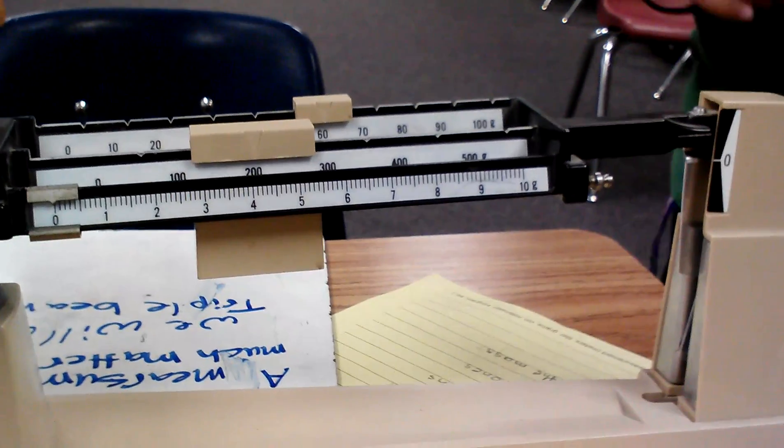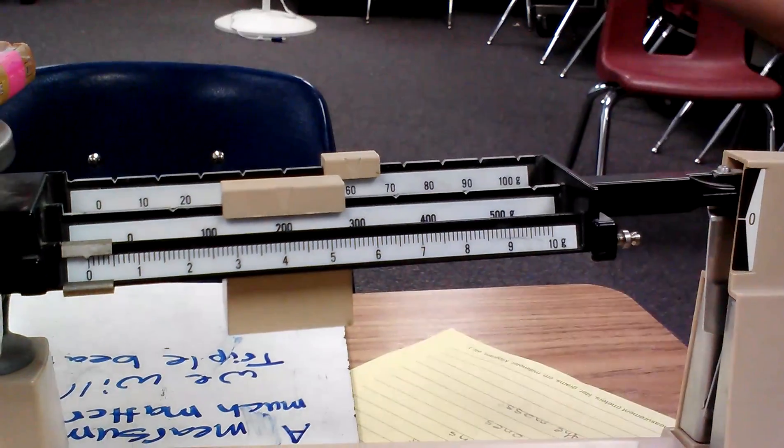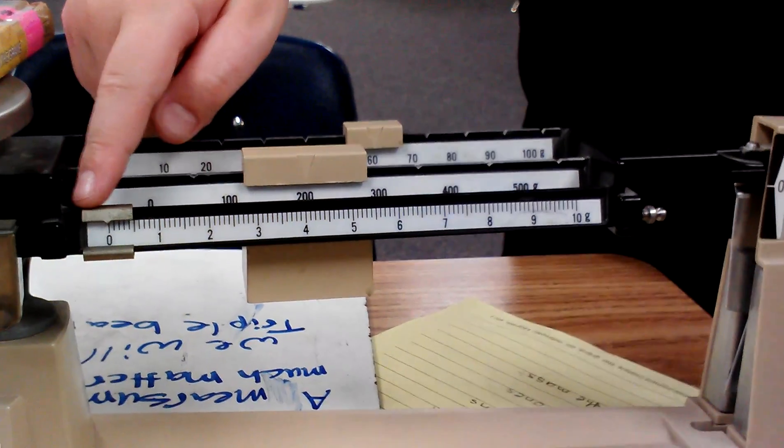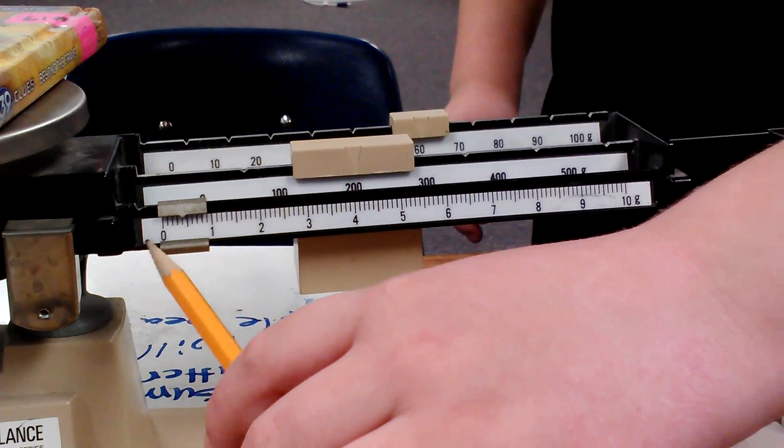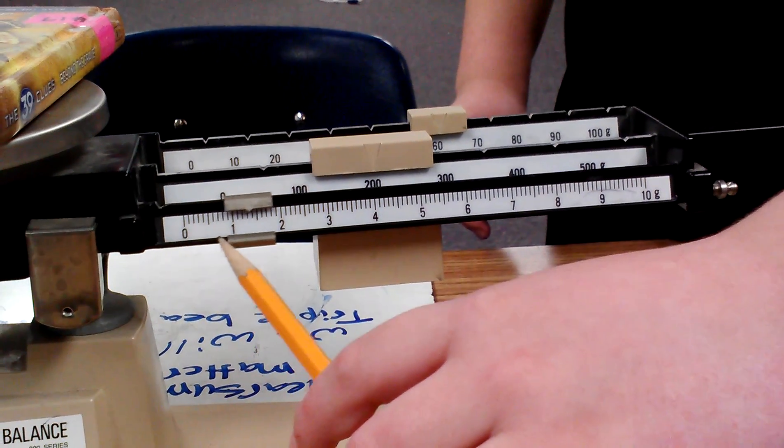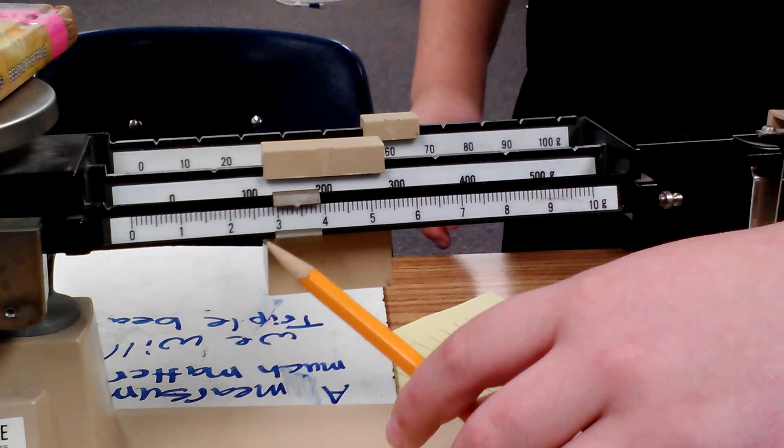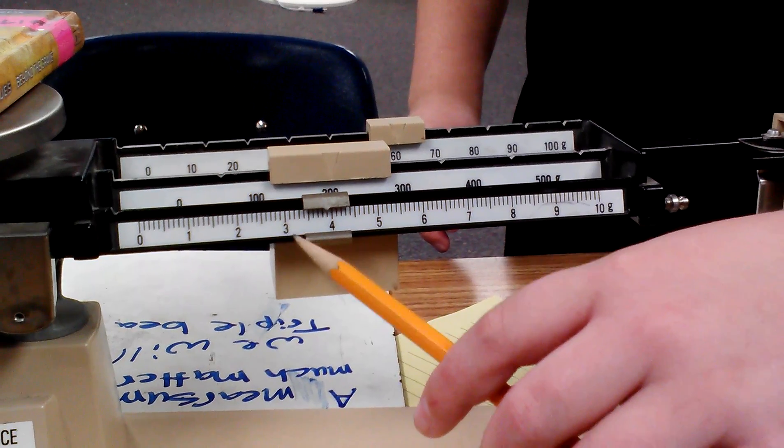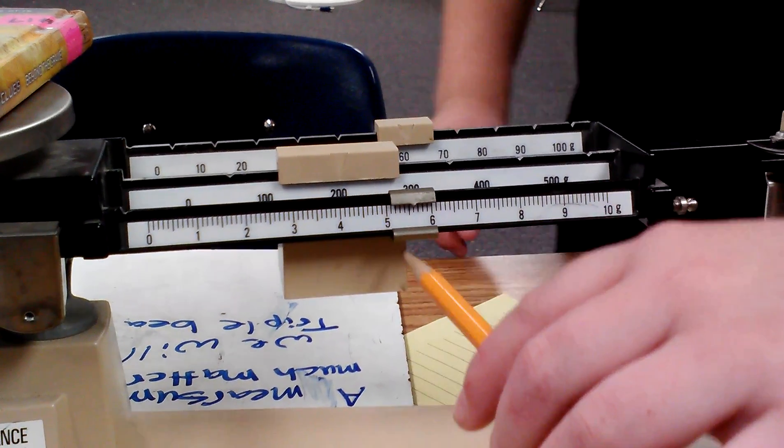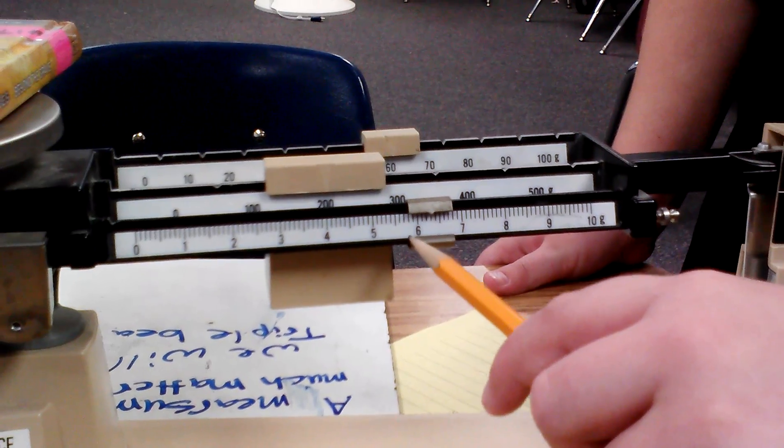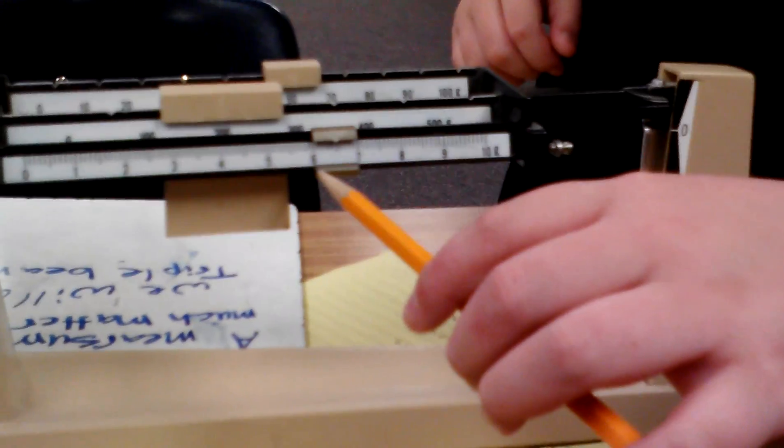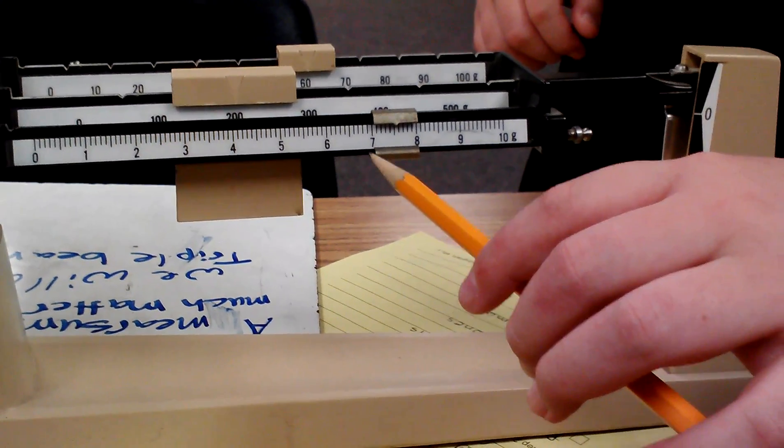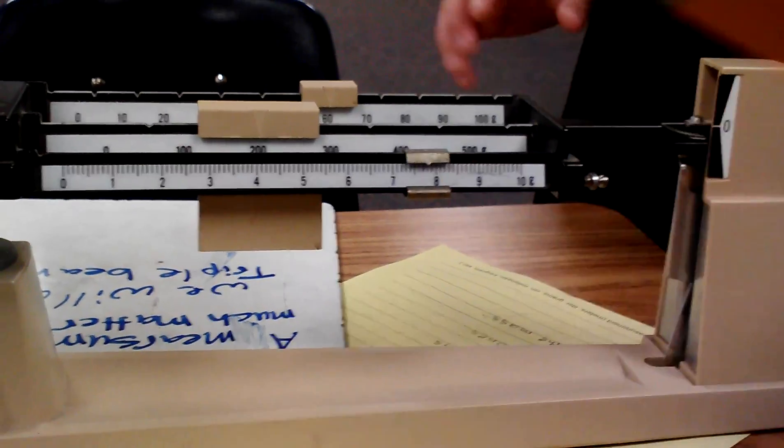And now, now I'm going to move the ones. Okay. Here, Tim, use the pencil, use it. So I move it here, here, closer. And keep moving.